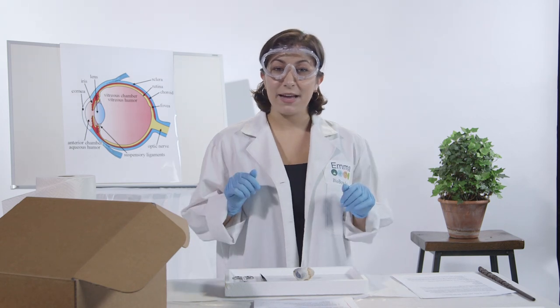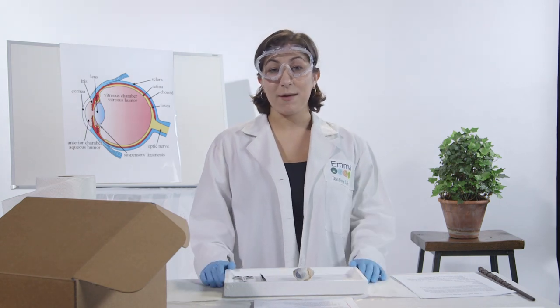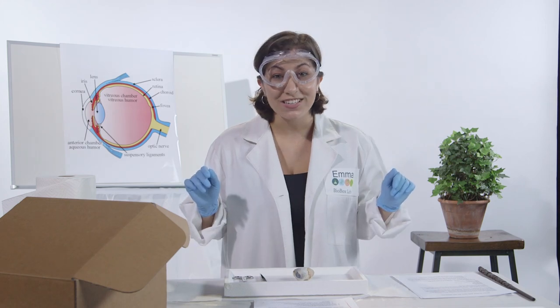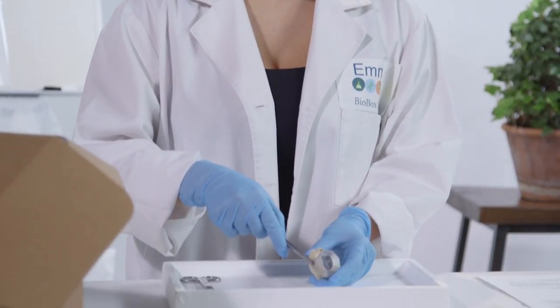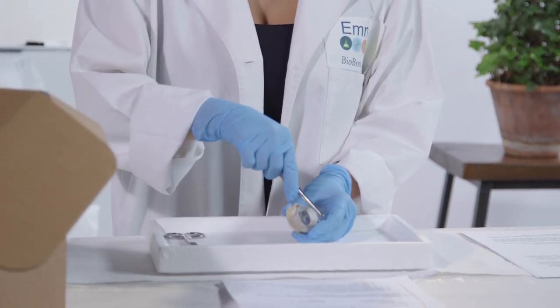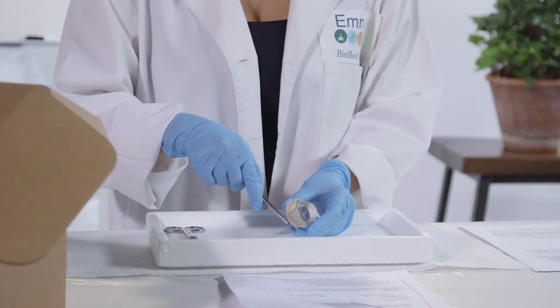Hey guys, now that I have my goggles and my gloves and all my supplies, I'm ready to start the dissection. So, this part right here is called the sclera. It is the thick white covering that protects the eye.